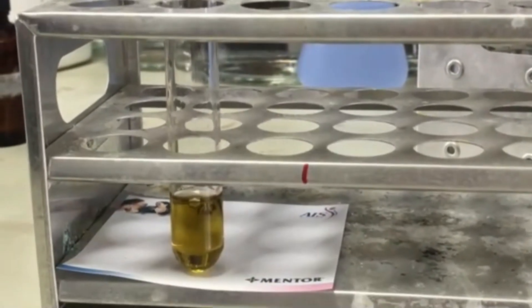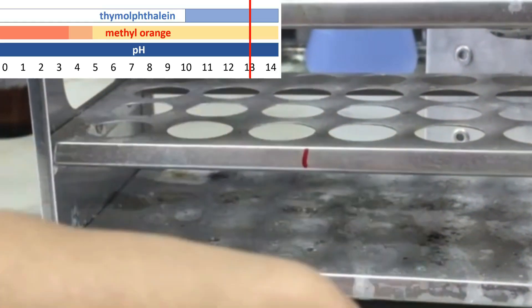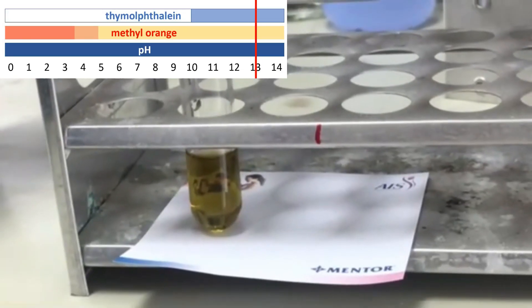The color of the solution turns green, and this makes sense because blue and yellow makes green.